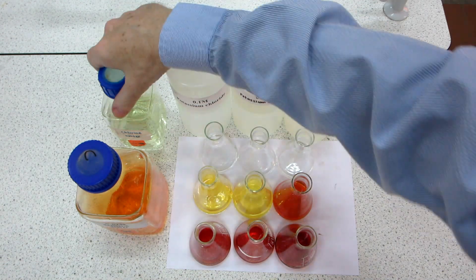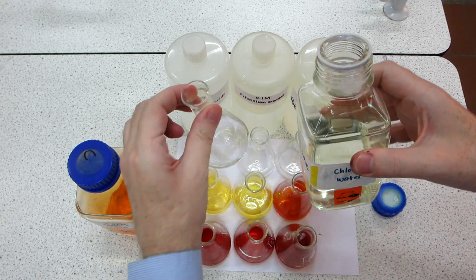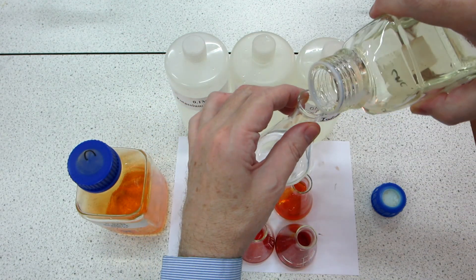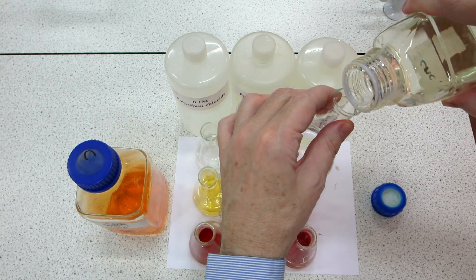Finally we have chlorine water. Here's the chlorine water, and we're going to introduce that into the three flasks. First, let's put some chlorine water into the potassium chloride, then chlorine water into the potassium bromide, and finally chlorine water into the potassium iodide.